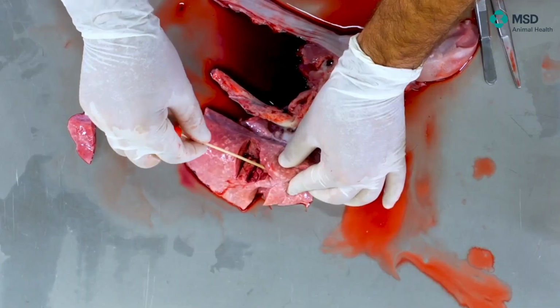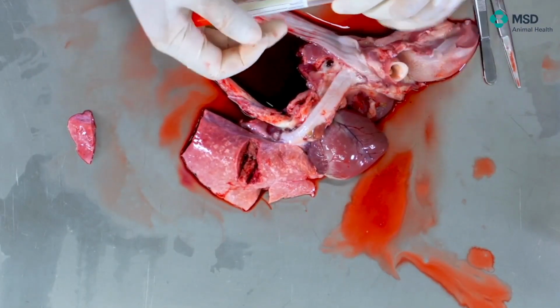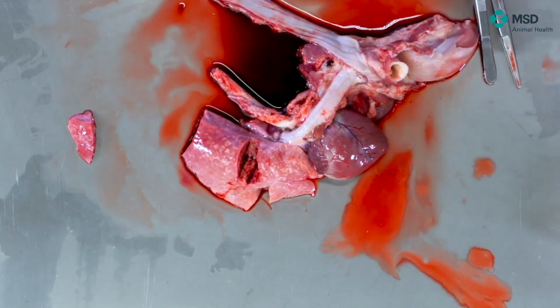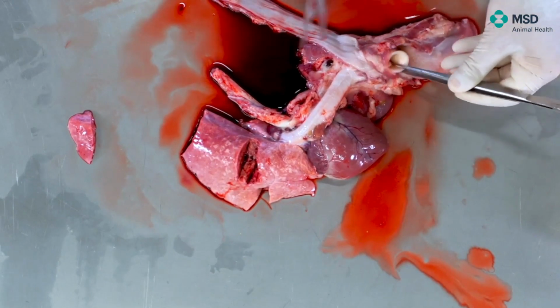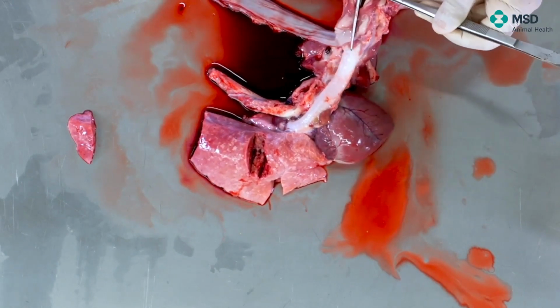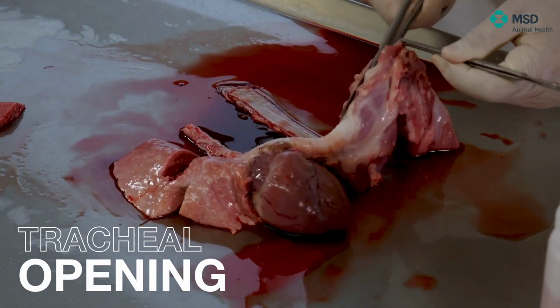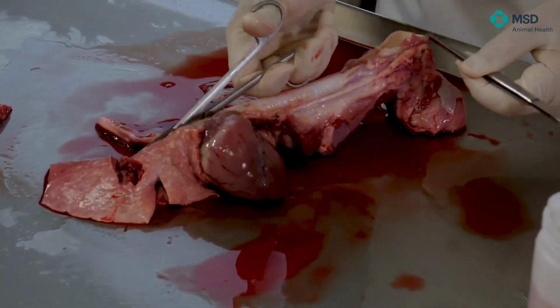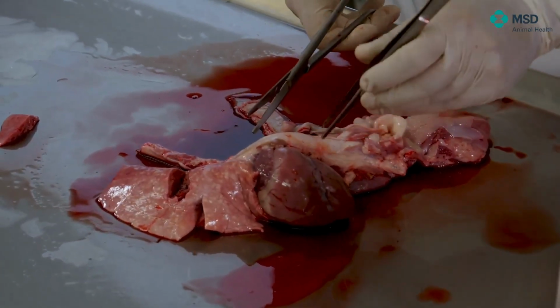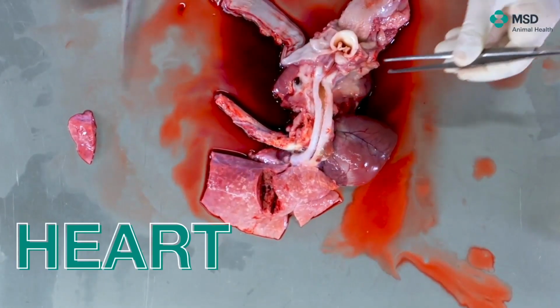Another thing that we have not already observed is the trachea. If we want to open the trachea, we do it longitudinally, as you can see here, until reaching the big bronchi. It's not very usual to find pathology in the trachea of the pig. Okay? So this would be for the respiratory tract in order to take samples and to do the corresponding observations, but we still have the heart.